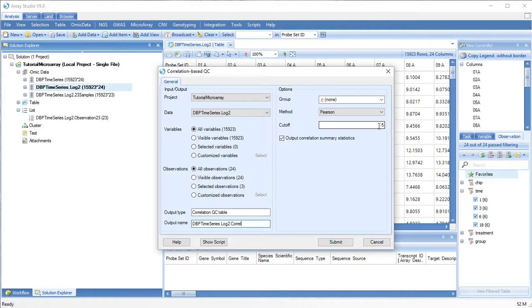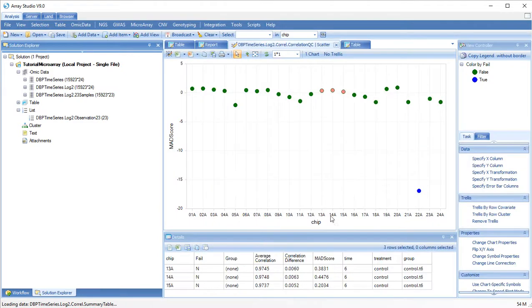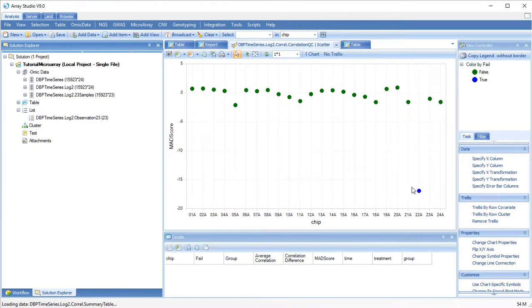In this module, for each sample, its average correlation to other samples is compared to the set of correlations between all other samples excluding each sample. If a sample tends to have lower correlation with other samples relative to the mean, this metric will be negative. The value is then converted to an MAD score. By default, a cutoff of -5 is considered a fail. We can see that one sample, chip 22A, stands out.